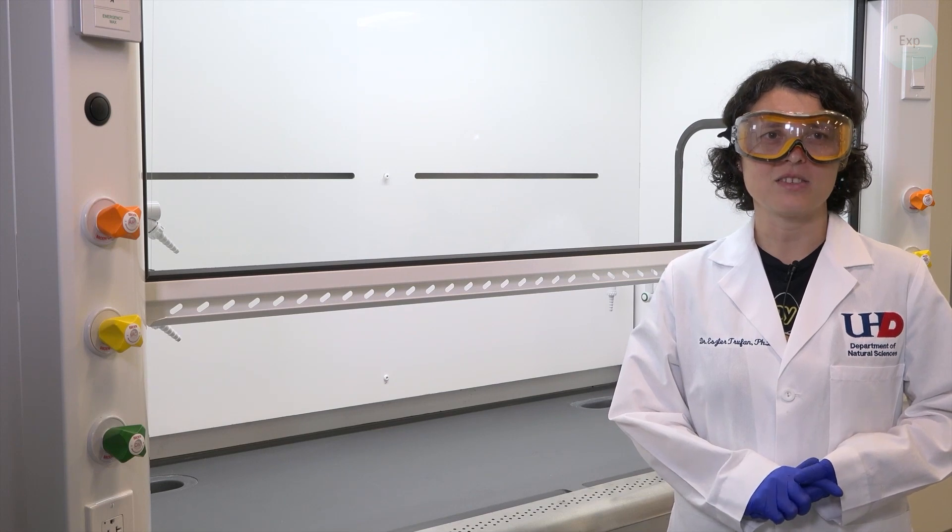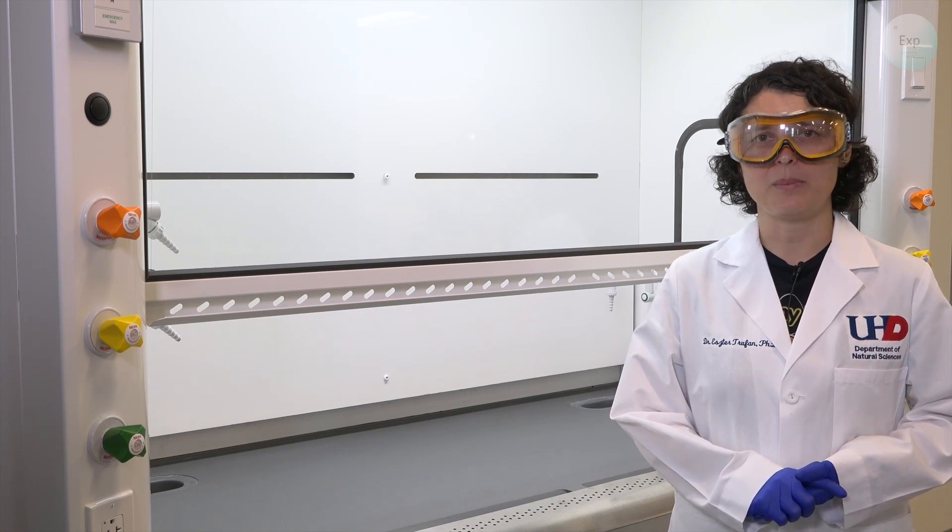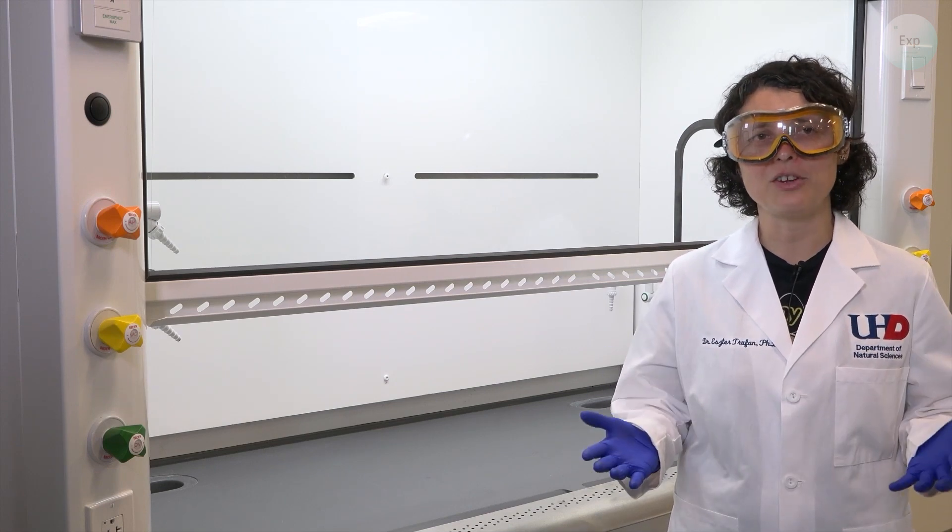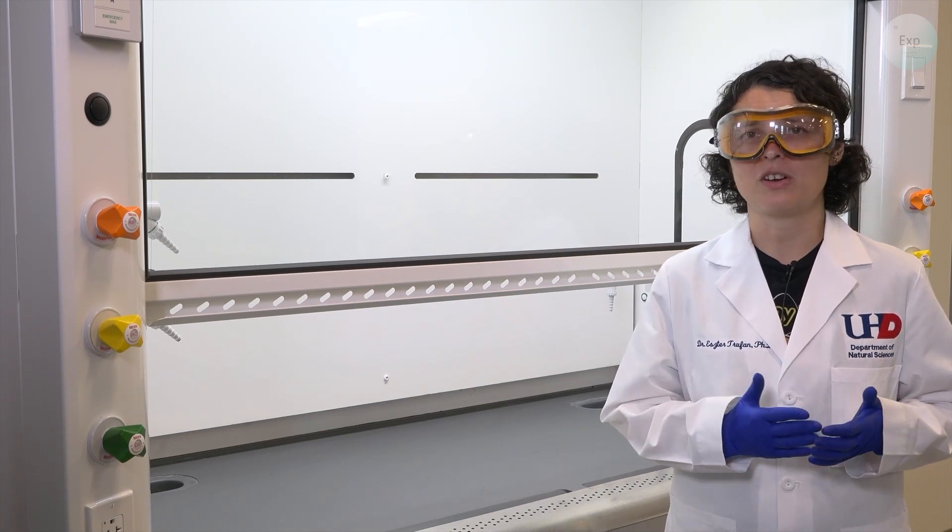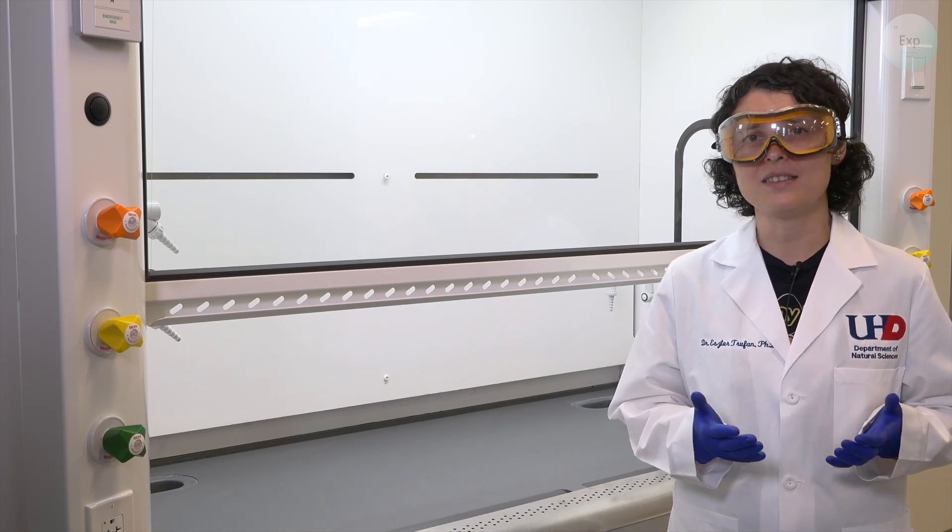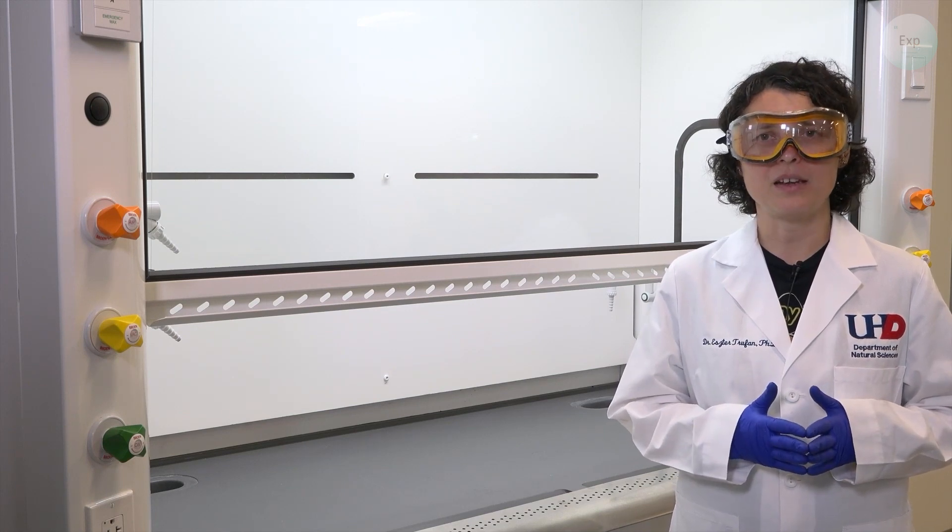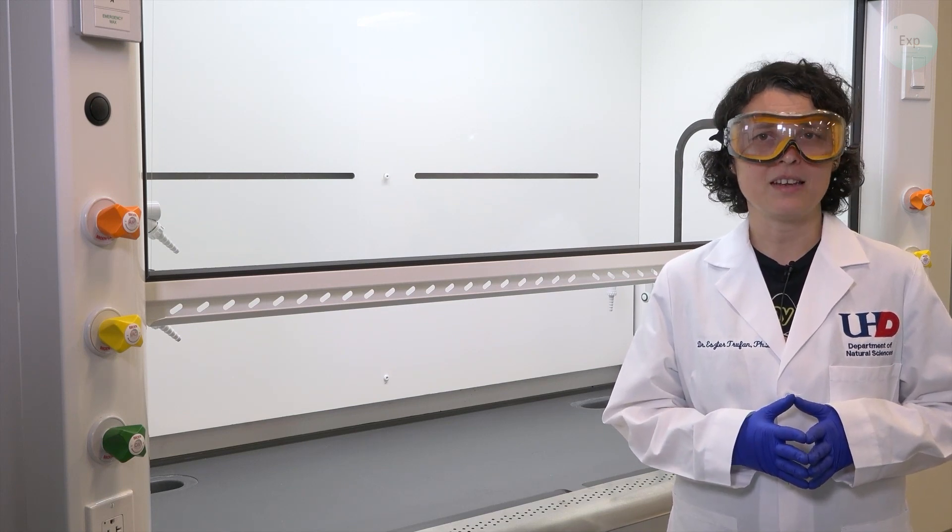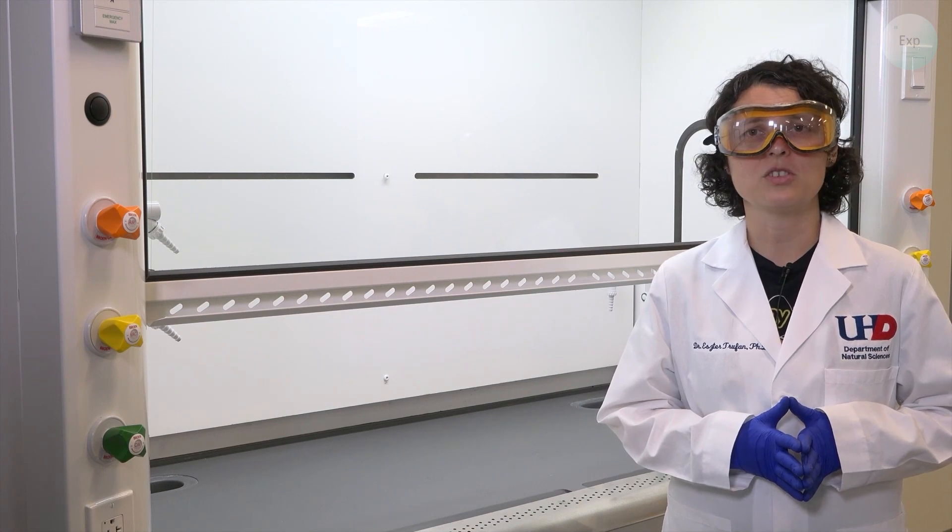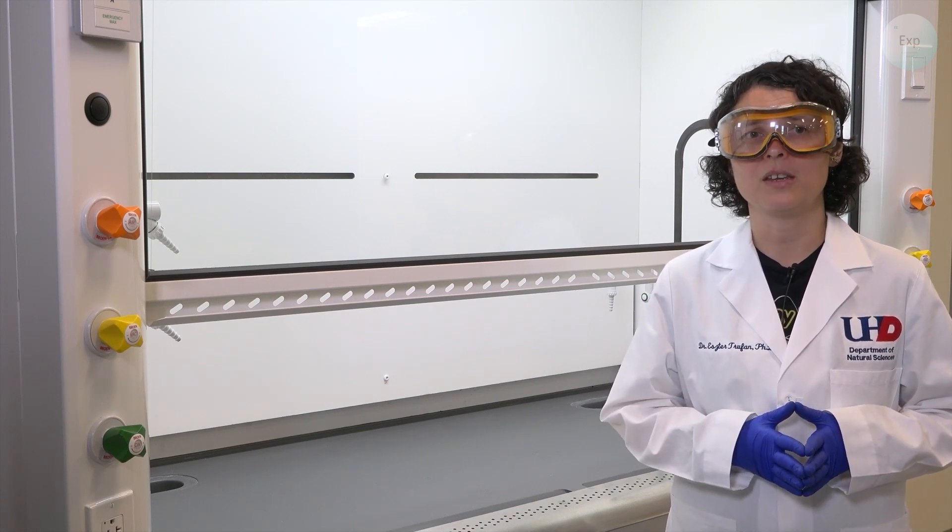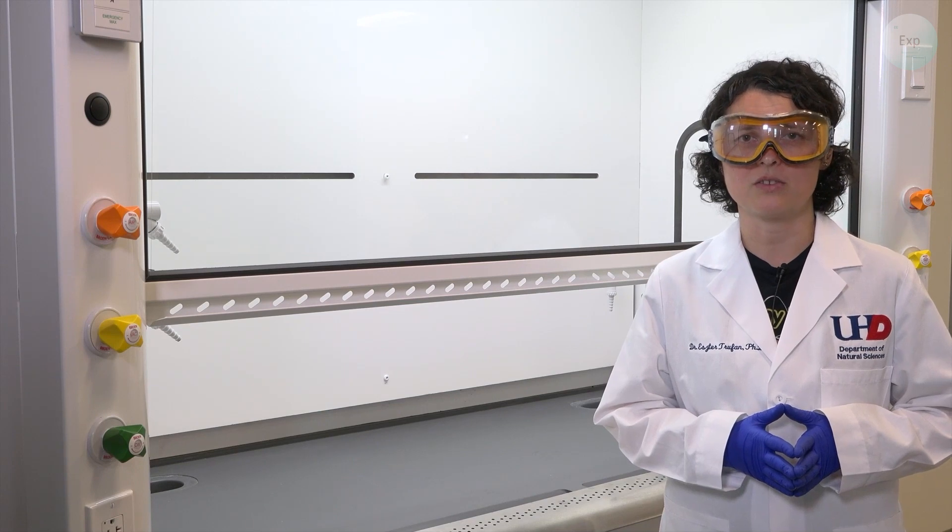The concentrated hydrochloric acid solution's molarity varies quite a bit and because we never know what is the original starting concentration, we only know an estimate of it, it is always important that after we complete the dilution experiment we have to standardize the hydrochloric acid solution to confirm how close or how far we got from the originally intended one molar concentration.